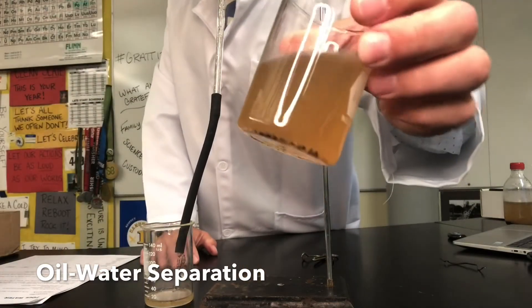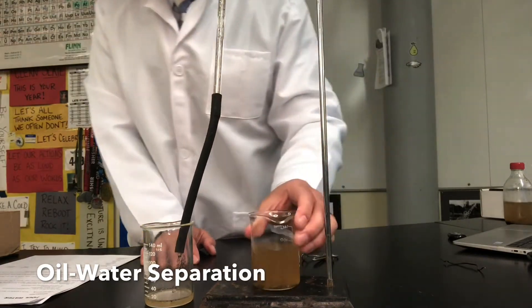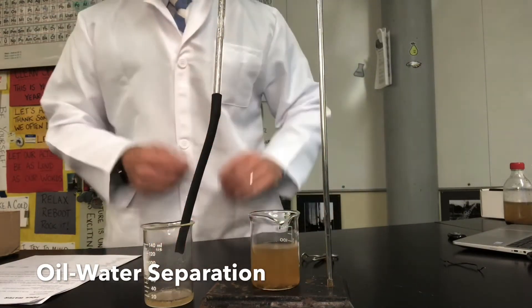By doing that we now have a slightly cleaner sample of water because we got rid of the oil through physical separation.